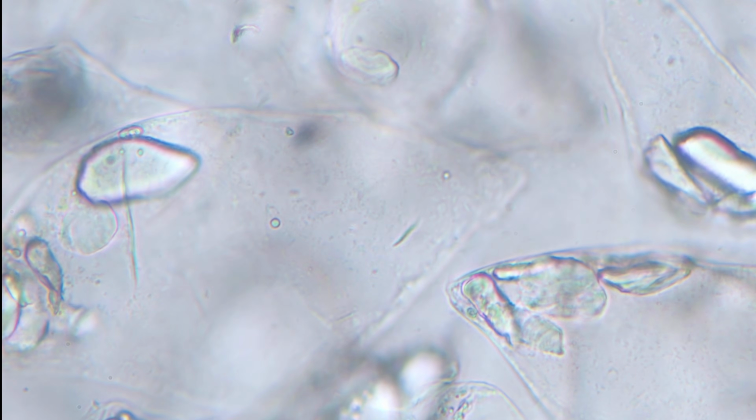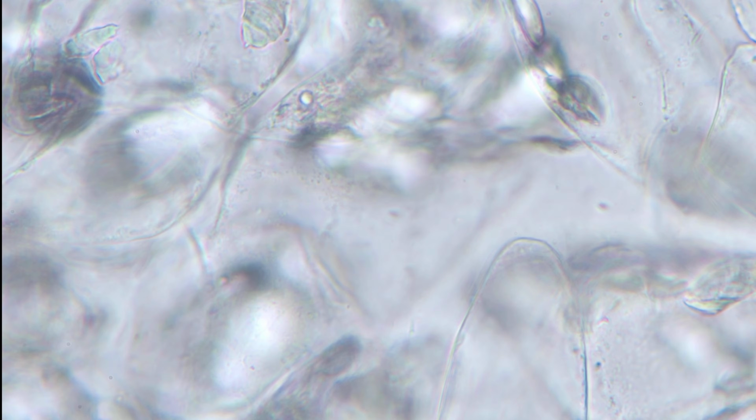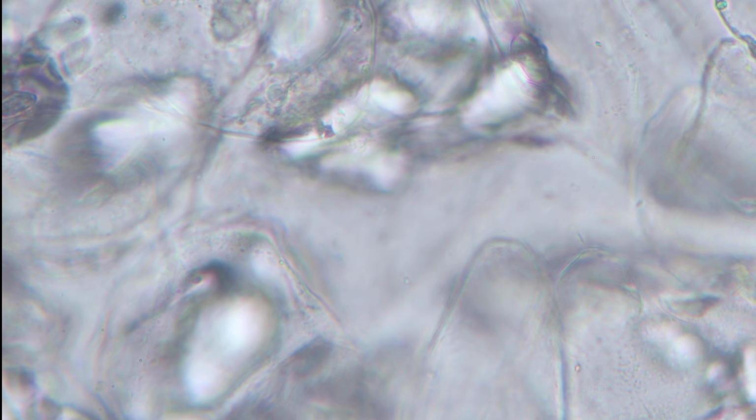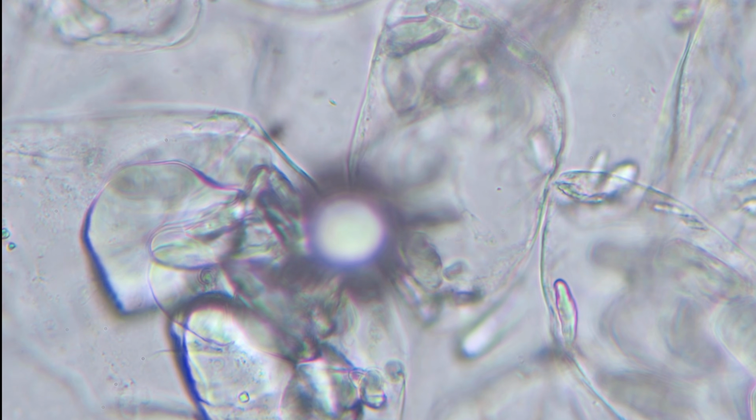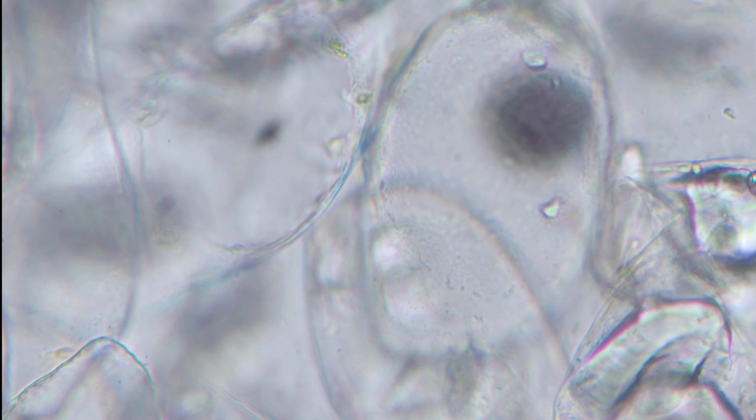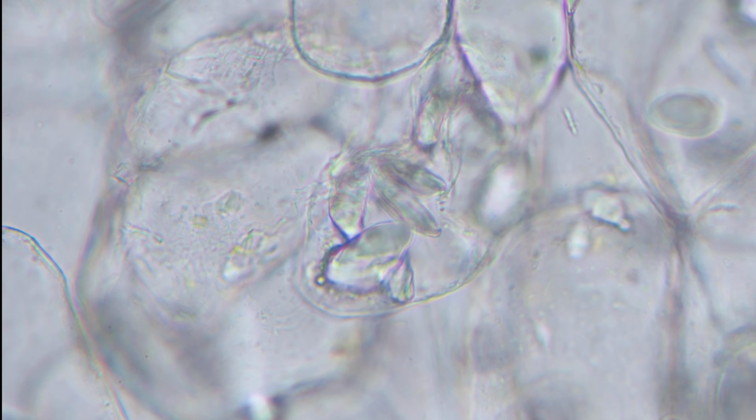And as usual, let's focus. And I'm sure you can see some granules. So granules, you'll find them in fruits or anything that will contain starch or carbohydrates, usually in such enclosed granules. And also, I'll show you something else. That's an air bubble, the one at the middle there. Remember, we're looking for anything that is moving, anything motile. That will be an organism.